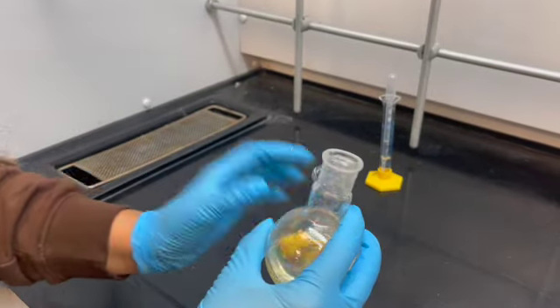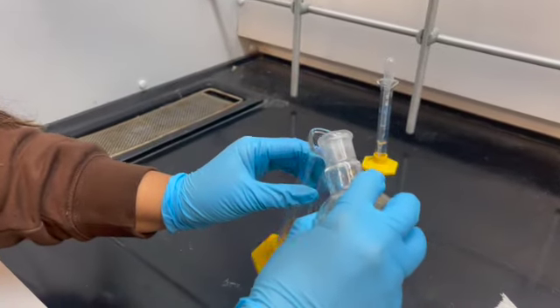Now we are going to dump our solution inside a graduated cylinder to see how much we have collected.